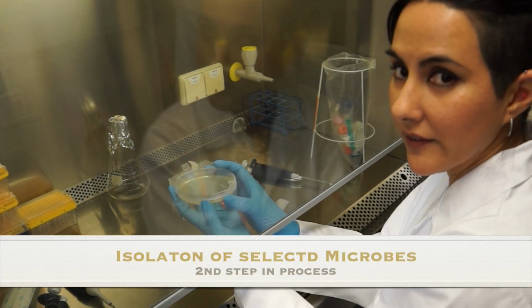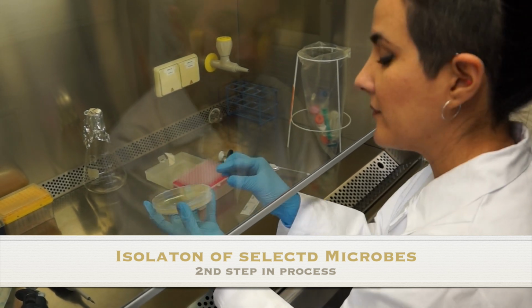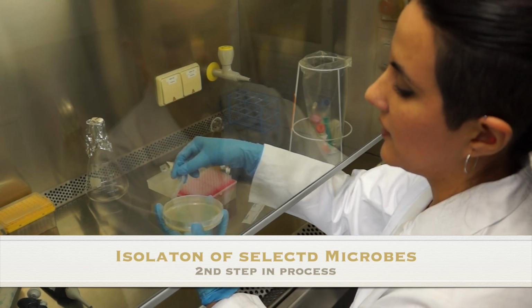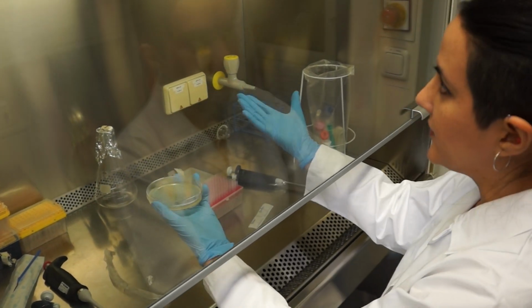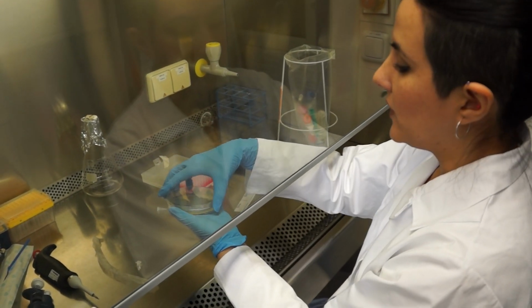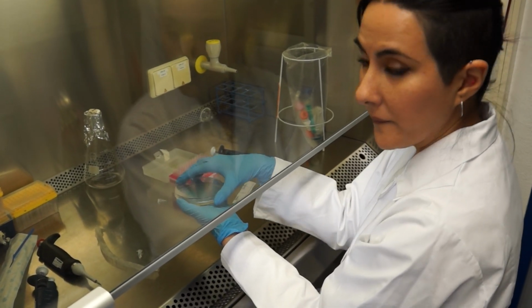So here we have an isolation plate. Inside there is a medium that is specific for some bacteria to grow. So we are under this system that is sterile. So we only want to keep here the bacteria that we are looking for.